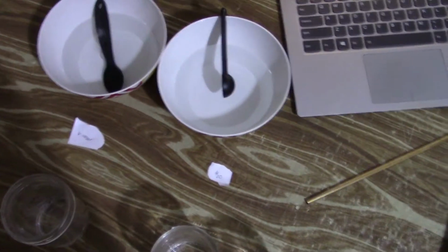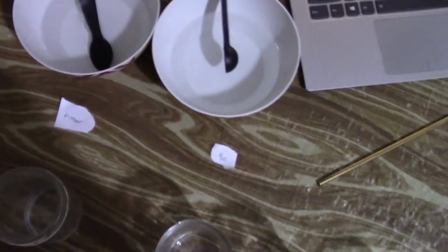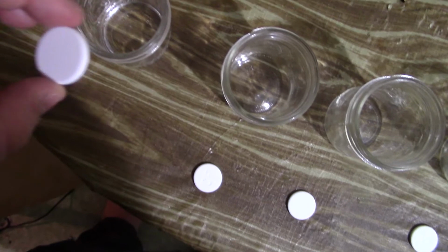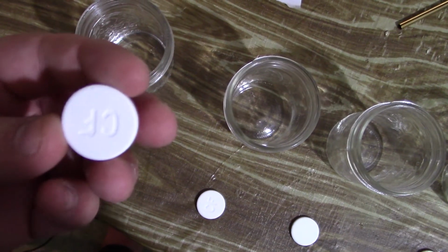When we're doing qualitative experiments, it's okay to estimate and it's okay to cut corners like this because we're just looking for an effect. And in this case, the liquid here is our excess reactant, so it's okay if we're not exactly on the dot in terms of measuring it because it is in excess, so we don't really care. It will always be there. Our tablet is the limiting reactant. That's what gets used up first.